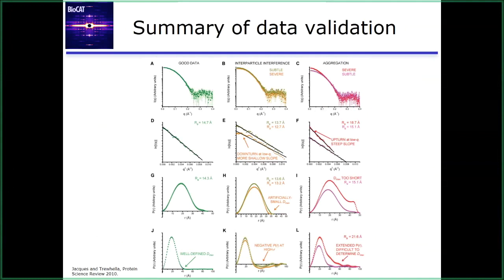And then this is the interesting point that I wanted to mention: if you do have interparticle interference and you extend out this Dmax, often you'll see a negative dip. It'll go down, instead of oscillating right near 0, it'll stay negative.